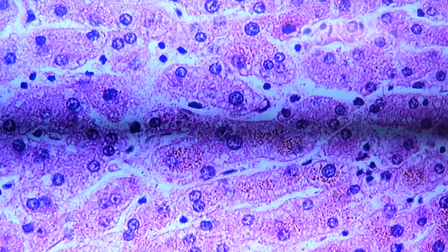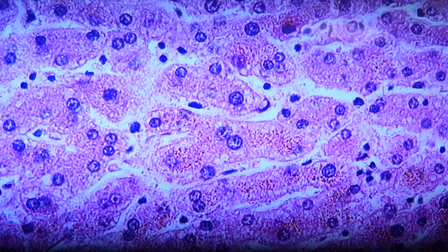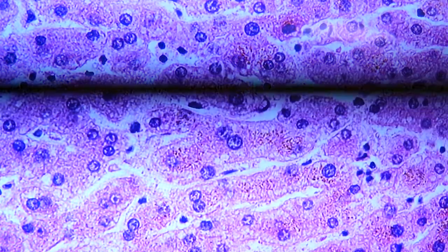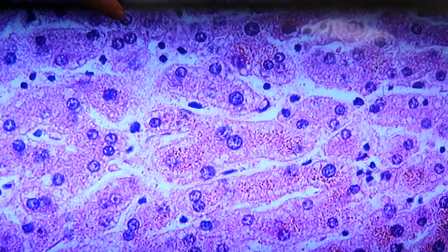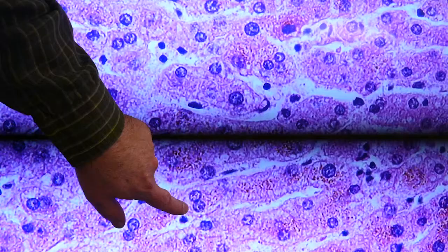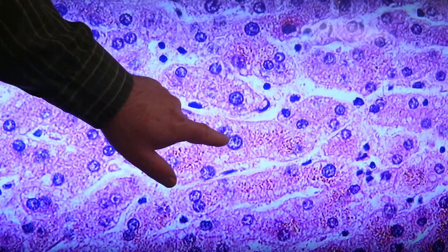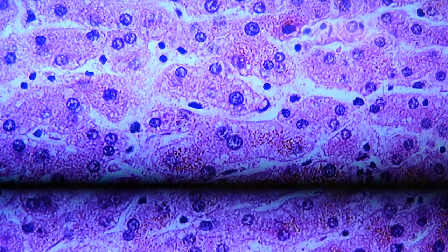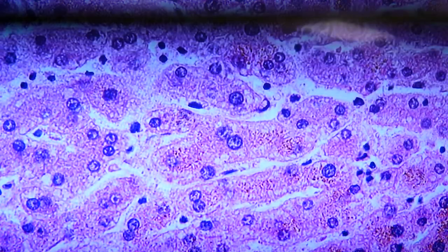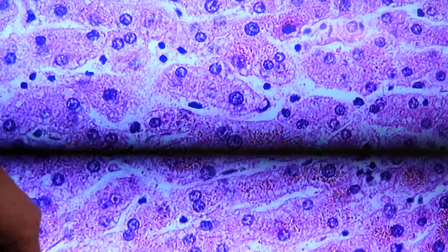Next, we're looking at hepatocytes and sinusoids, endothelial cells and Kupffer cells in these examples. So the larger pink cells that make these continuous kinds of loose strands through here, these linear pathways, these are hepatocytes. It's common to see two nuclei together in a hepatocyte. It's a very common thing to see, double-nucleus hepatocytes throughout the tissue. The white space represents the sinusoid.